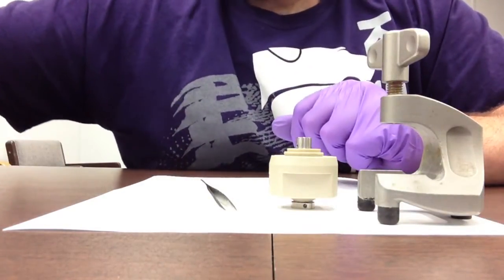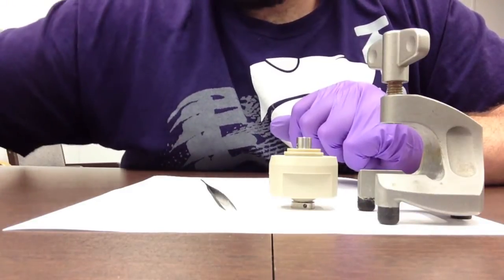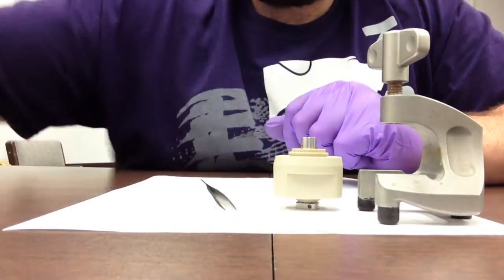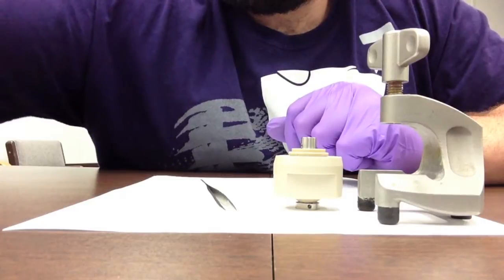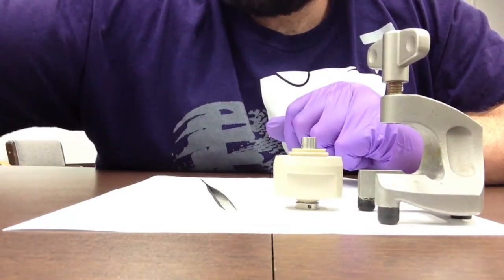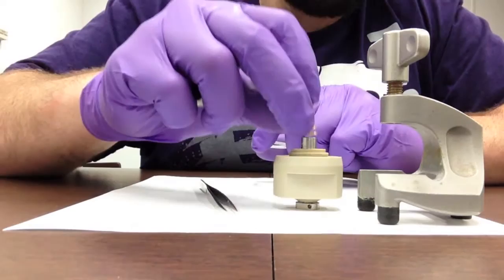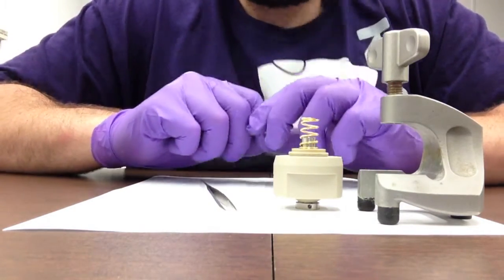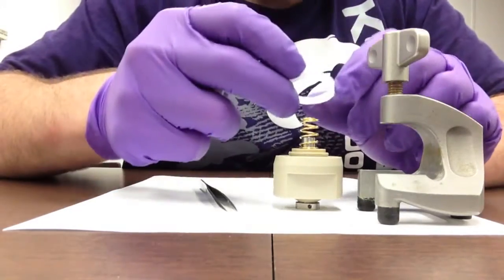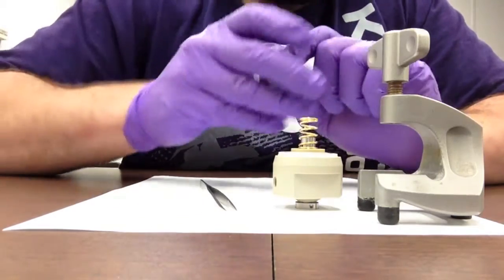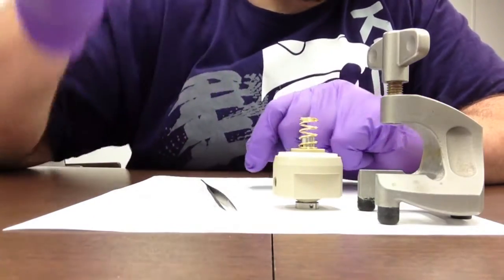Before we go into more, we can look at assembling the actual top. With this cell designed to create pressure onto the cell, it requires this gold-coated spring, which also has a polyethylene spacer, or sealing ring, to protect the entire device and make it airtight.